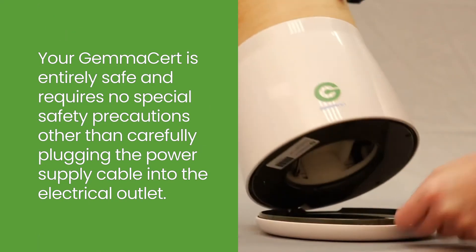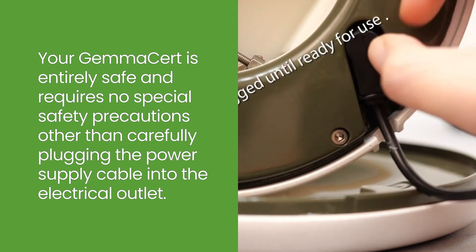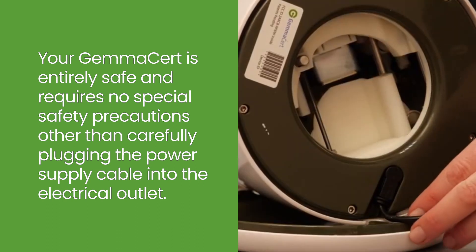Your GemmaCert is entirely safe and requires no special safety precautions other than carefully plugging the power supply cable into the electrical outlet.